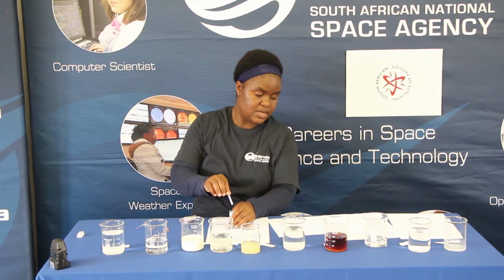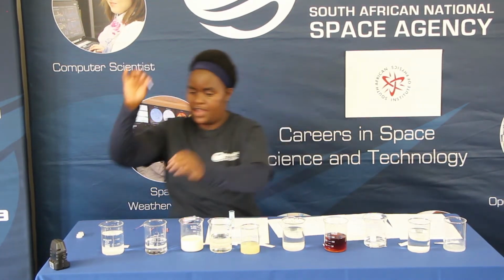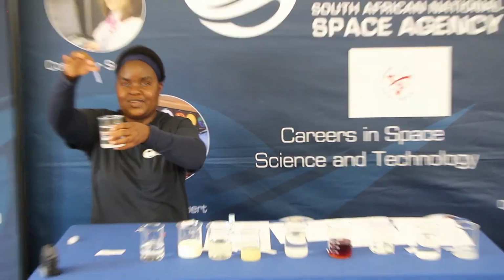The next one is the baking soda solution. Yeah, we found it. It's right here at the corner. Observe what happened to this paper.